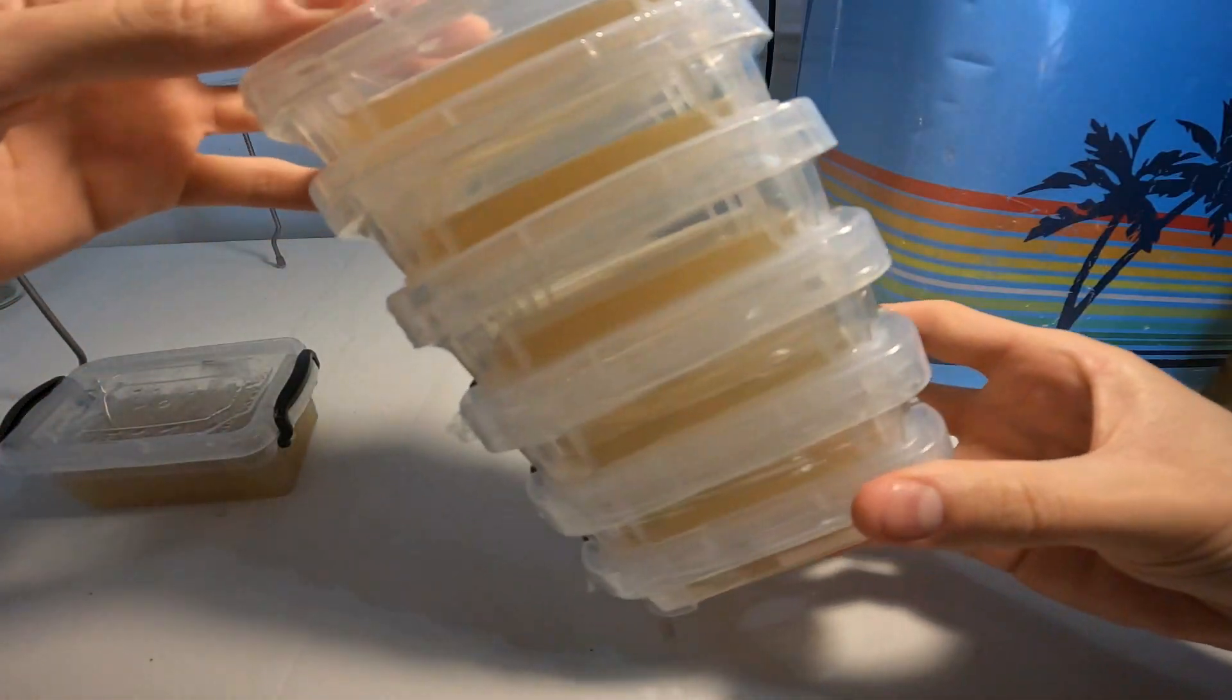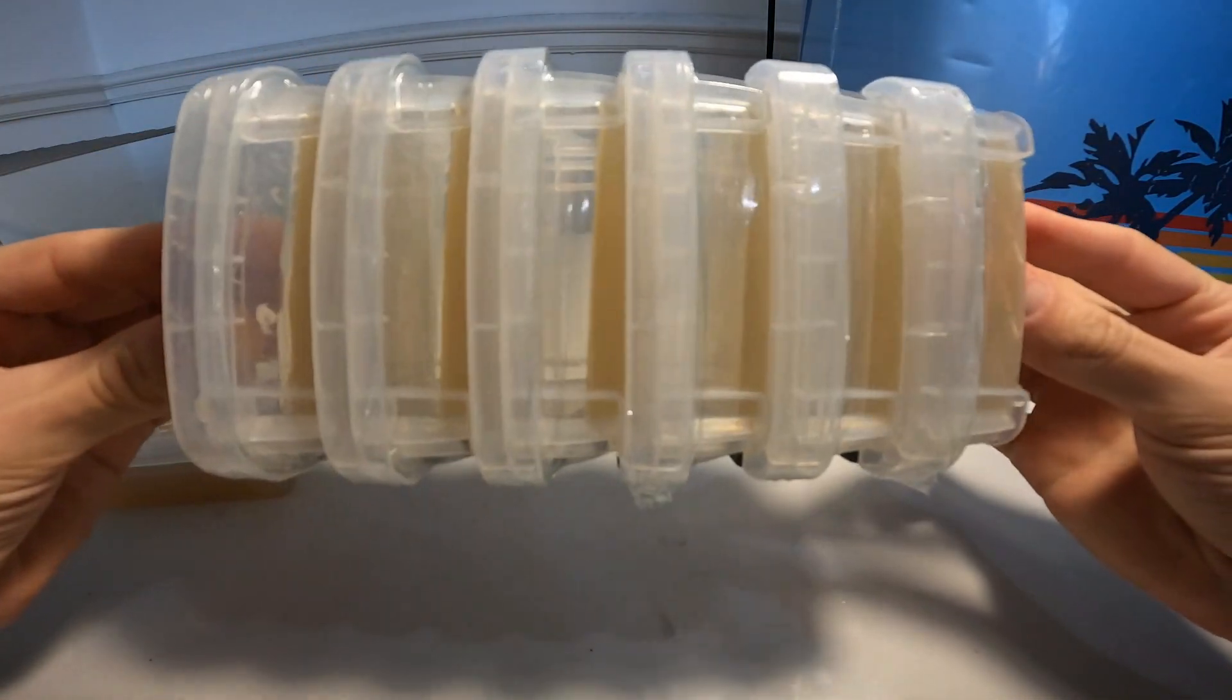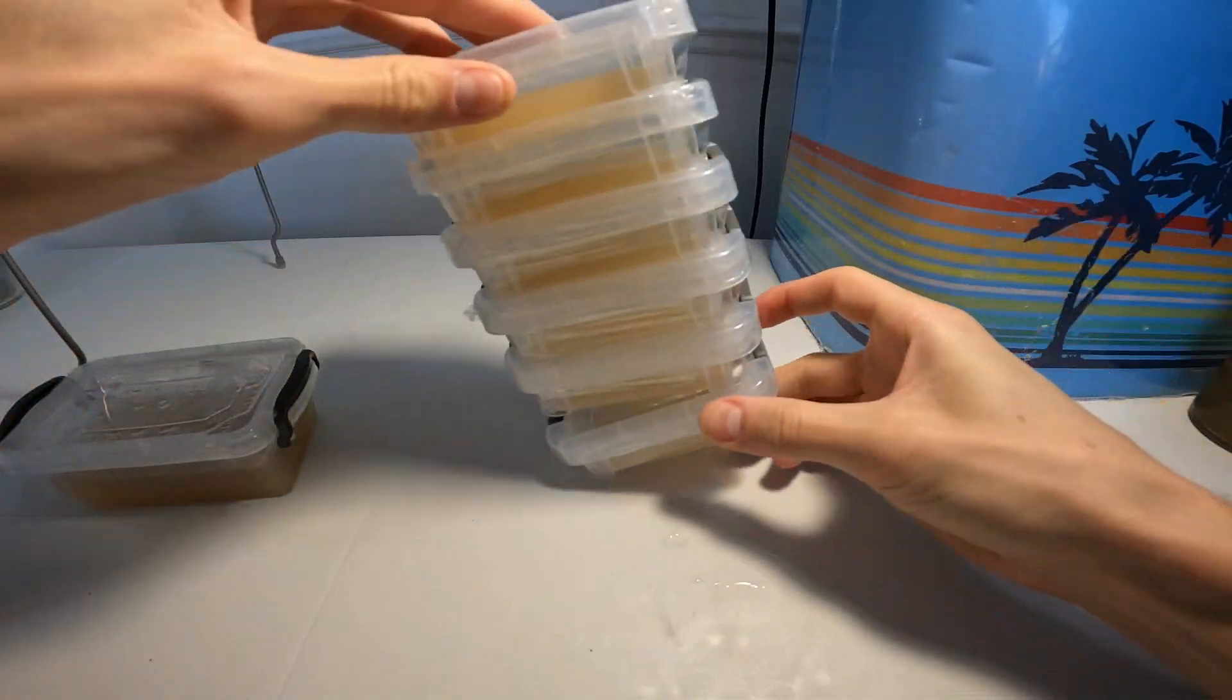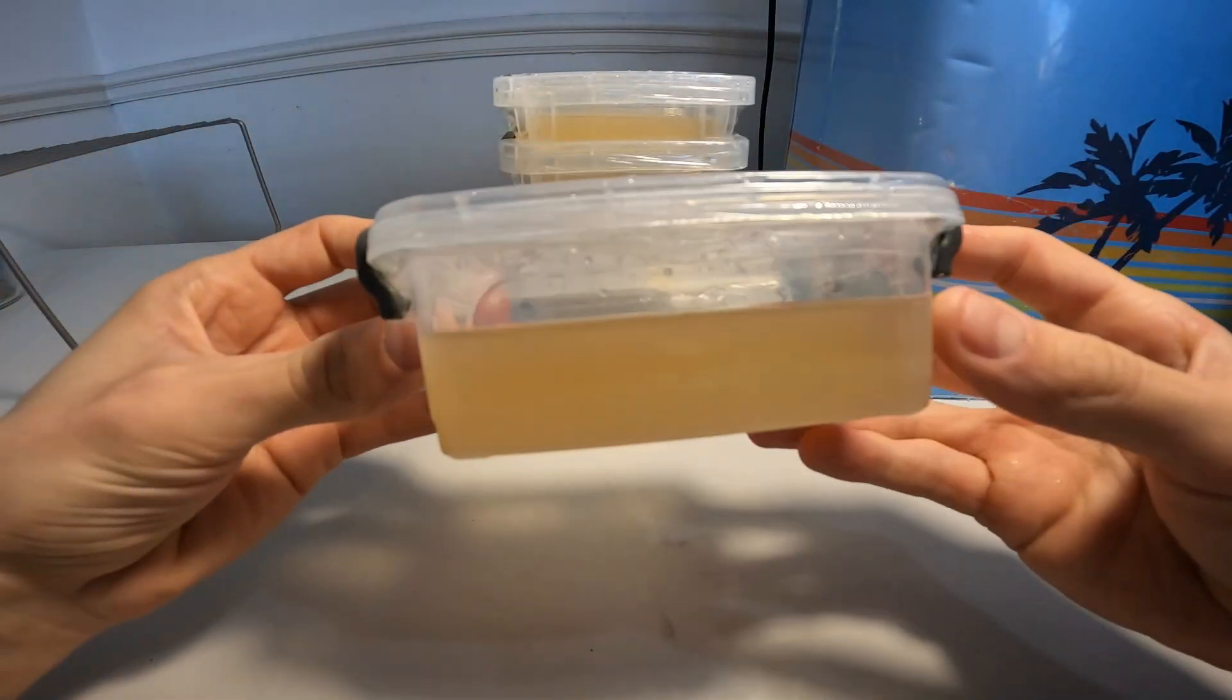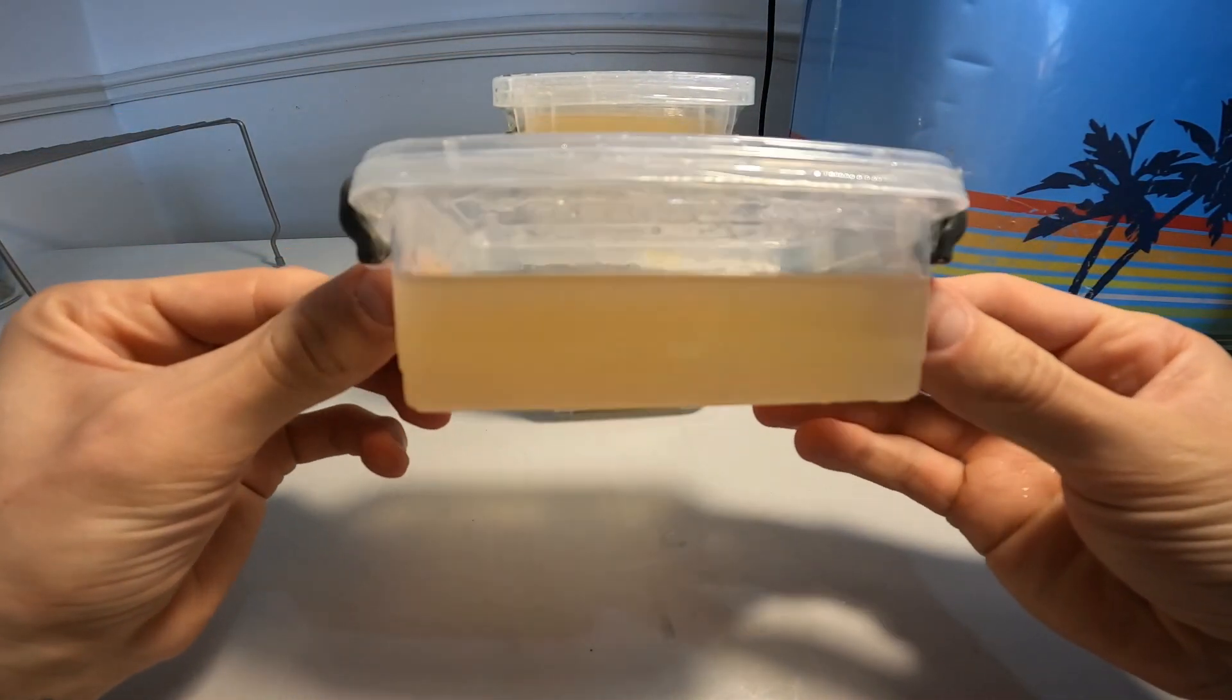And there we go, my new petri dishes are all complete. And generally I'll just store these in the fridge along with my singed fingertips. I hope you enjoyed that video and let me know what I should do with this one.